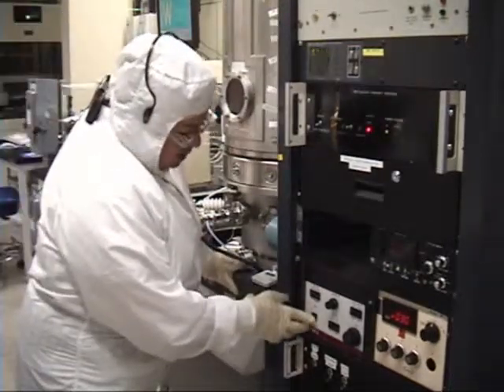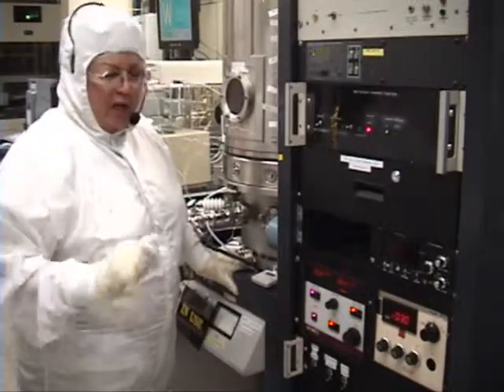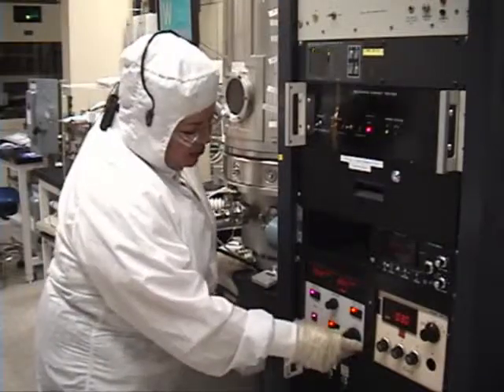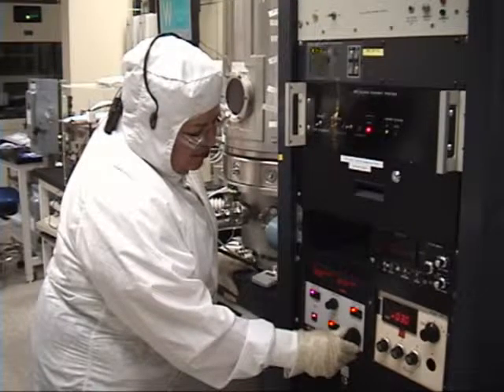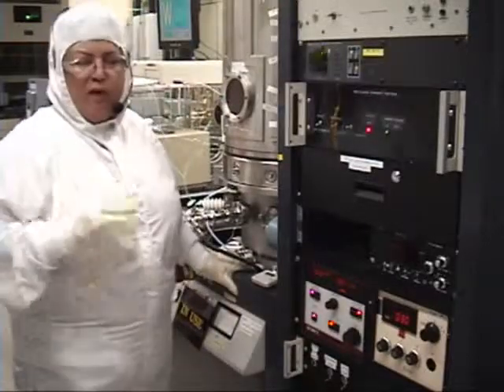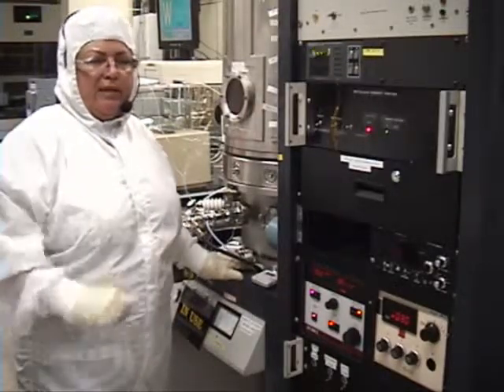This is a one-minute sputter to clean up the target only. We're going to press on for the power supply. We're going to press set point because we have to tell it what power — anywhere from 50 to 100 watts, do not go over 100 watts. We're going to run titanium at 75 watts. We unlock the level, adjust up. This set point is at 79 — there's a correction factor of four, so when the actual sputtering starts it will say 75 watts. There is a correction factor of four on all power you're using. If it's 100 watts, you're going to set it at 104.